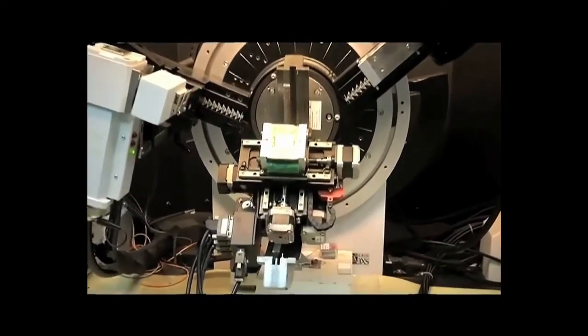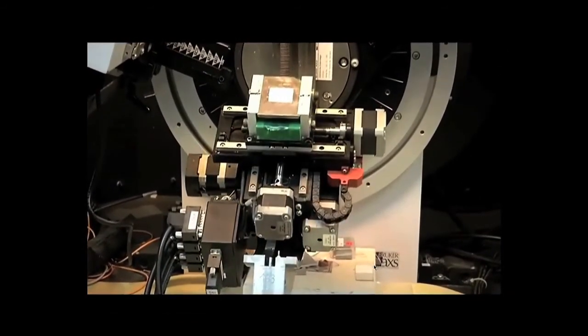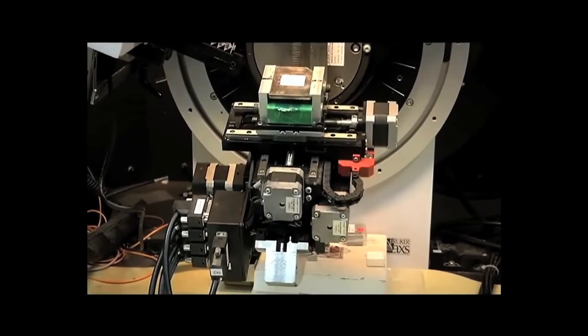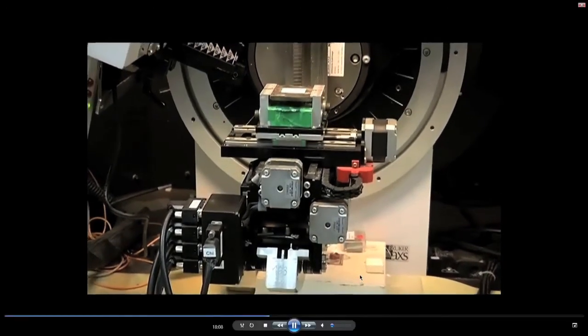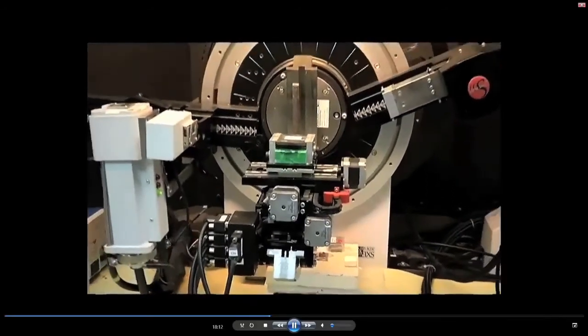And these rotations are completely exploited in the case of texture measurements, which we are not showing. We are trying to just show the instrumentation detail and what the possible tilt angles are and so on. And we will simply look at the basic diffraction data which comes out of this sample.